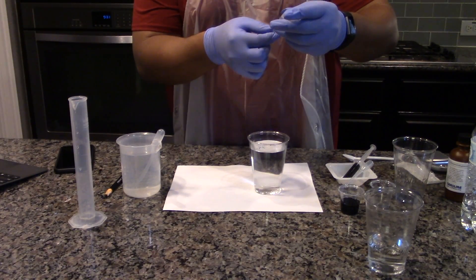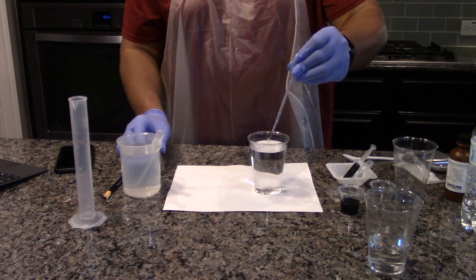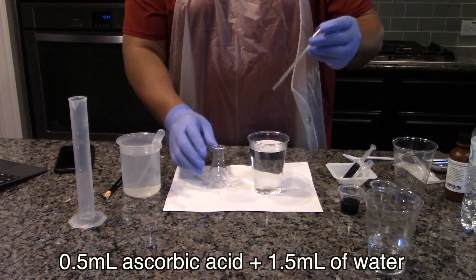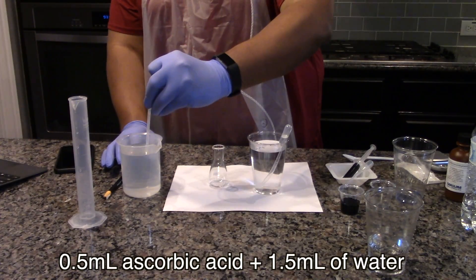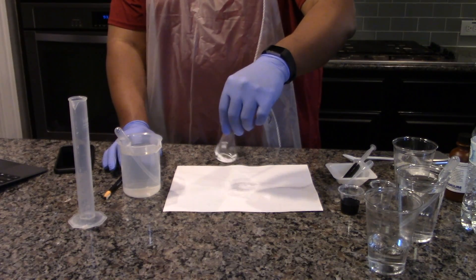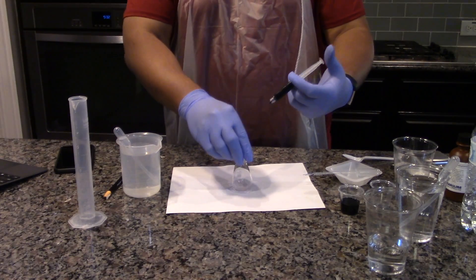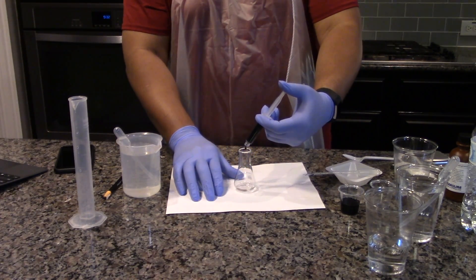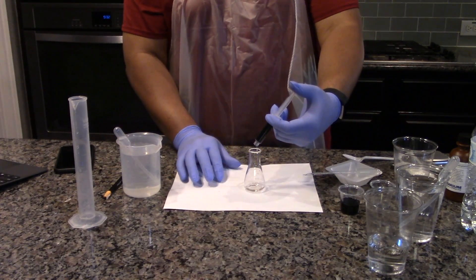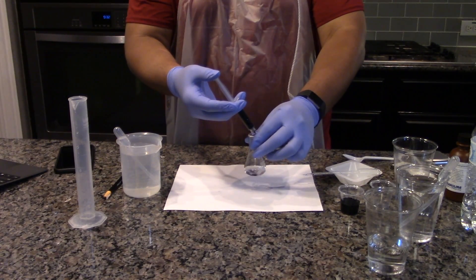Perform the titration for the 0.5 grams per liter ascorbic acid solution. Transfer 0.5 milliliters of the ascorbic acid stock solution to the flask and add 1.5 milliliters of distilled water. Transfer DCPIP to the flask dropwise from the syringe until the solution in the flask has a distinct blue hue, similar to what was seen in the endpoint step. Gently swirl the flask as needed to achieve a uniform color.